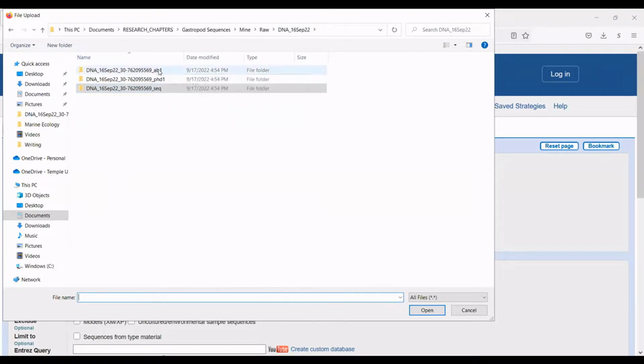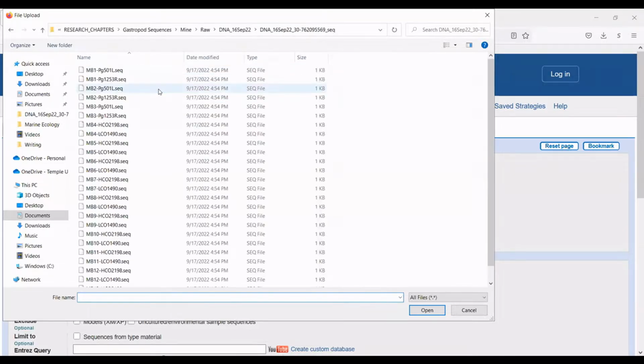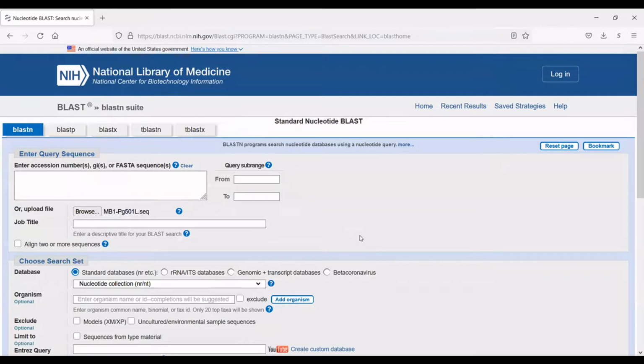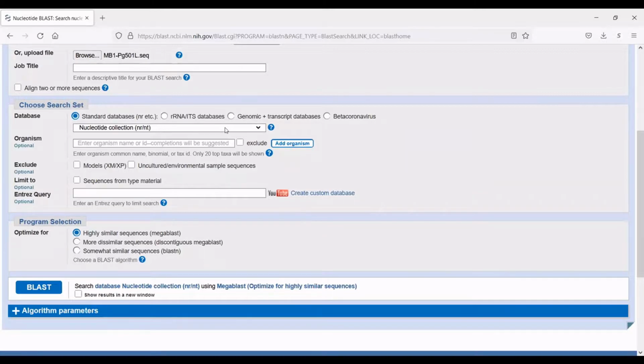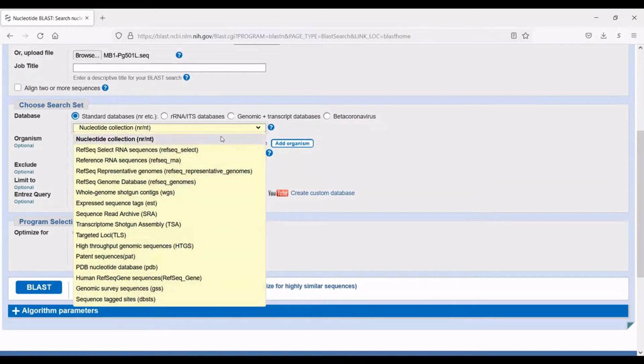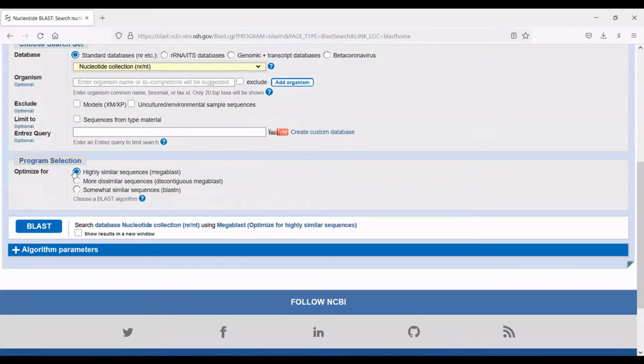So the AB1 are the trace files, which we'll look at later. The sequence files are just the raw sequence files. So there's no cleaning that's been done. And at this point, you don't really need to clean things in order for BLAST to function. So I'm going to select this first sequence. I'm going to open it. And everything here can pretty much stay the same. You can select which database you want to search against. I am personally interested in the nucleotide collection. And I'm going to search for highly similar sequences. Okay, so then I am going to hit BLAST, and I will be back when I get the results.